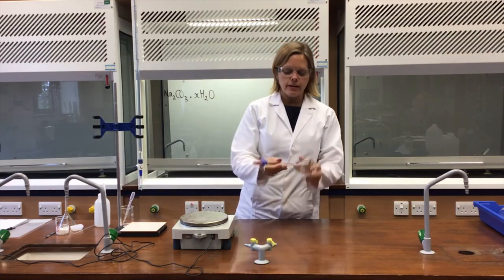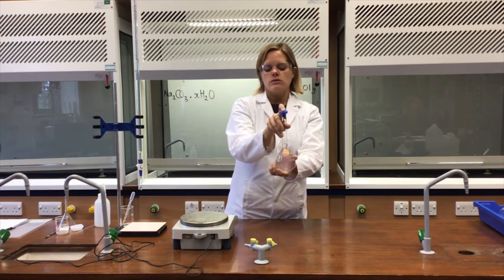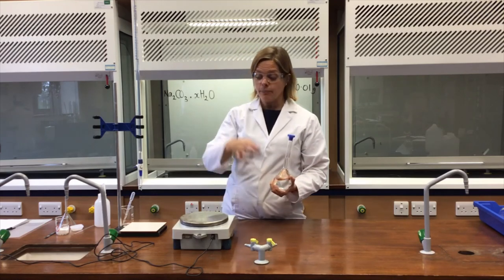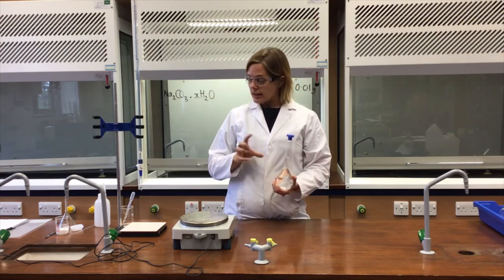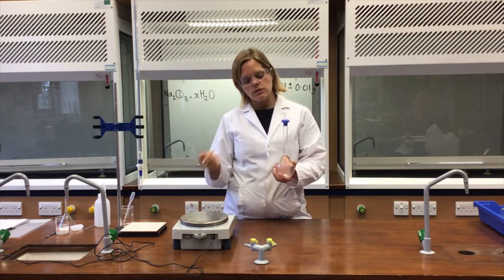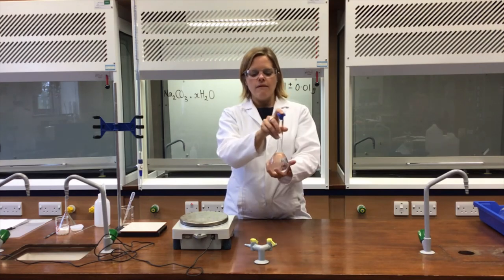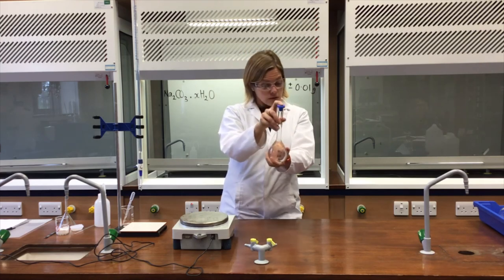The meniscus is just sitting on the line, so I pop the stopper onto the flask, hold it on, and invert the flask several times to mix the solution thoroughly so the concentration is consistent throughout. Key points: (1) weigh by difference; (2) dissolve the solid in distilled water; (3) transfer with rinsings into a 250 cm³ volumetric flask; (4) make up carefully to the mark with distilled water; (5) stopper and invert several times to mix.